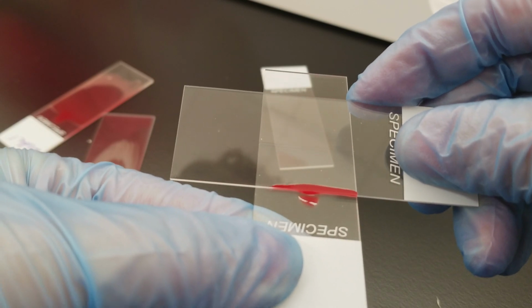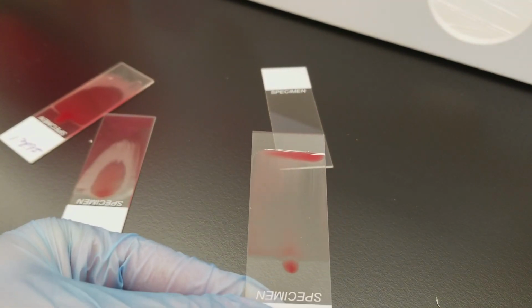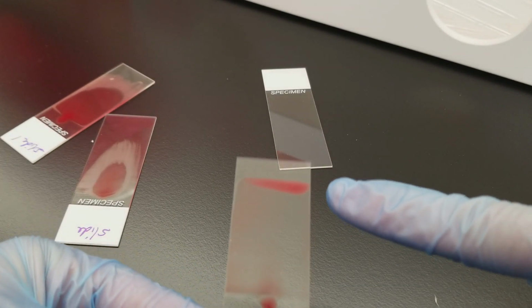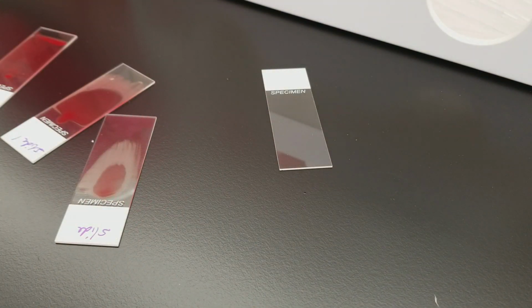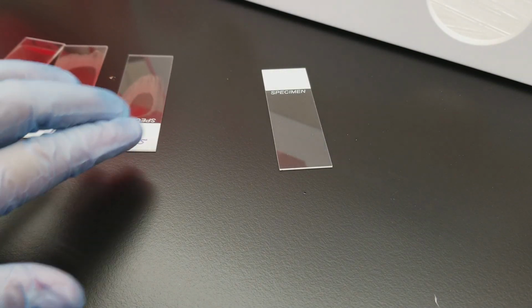So pull it back and see, it's not going to spread out evenly. It's going to be way too thick. So here, if you'll notice at the end, that's not good at all. Okay, that's a really bad slide. You want something that is going to have a sheen around the feathered edge, and you're going to want to keep replacing that spreader slide so that you have a nice clean one.